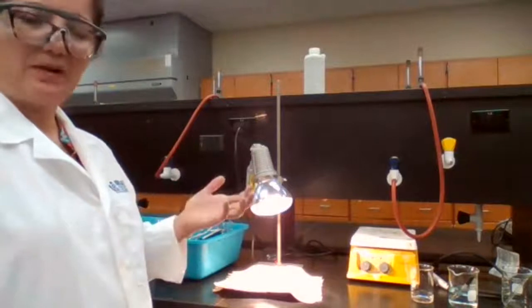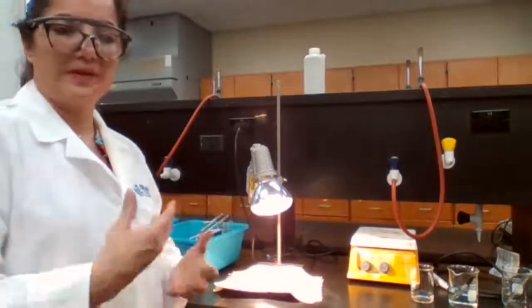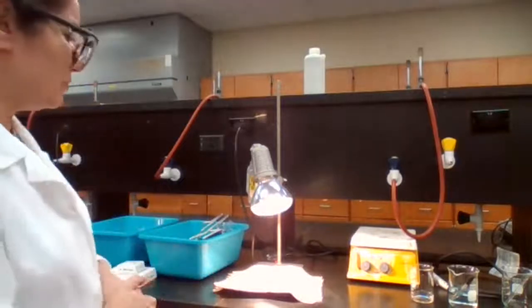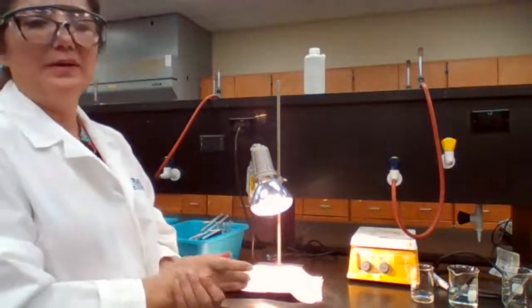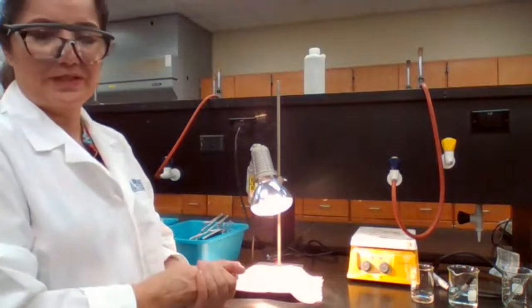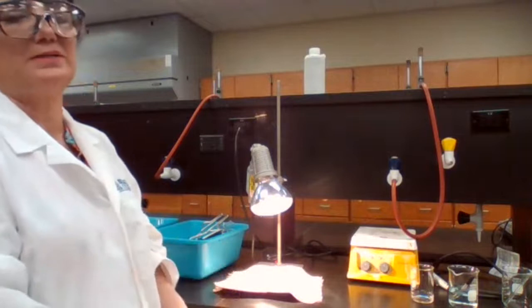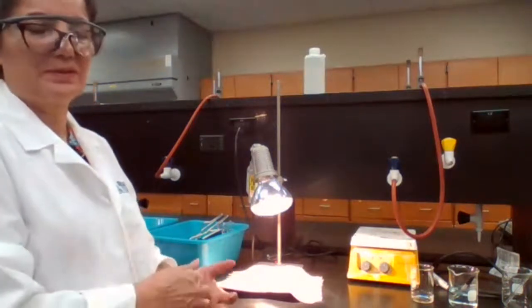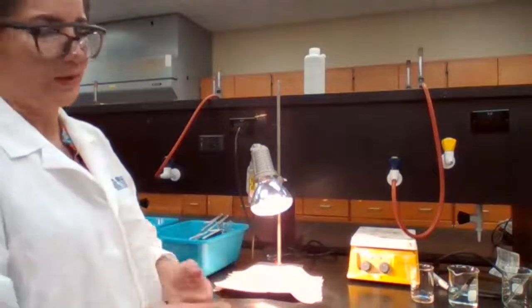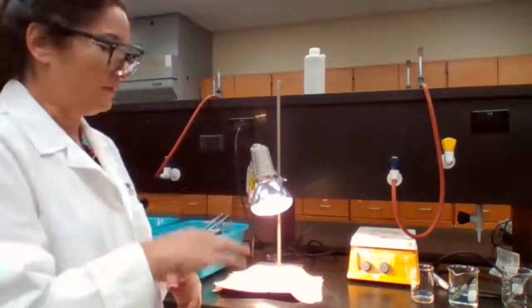It can be higher than 100%, it could be lower than 100%, but the point is for you to understand how could you make it higher or lower. So in case you were teaching someone to perform this experiment, you could tell them, be careful not to do this, not to do that, because if you do this or that, you are going to get less than 100% or more than 100%, which none of them is good. Too much of either one is not good.